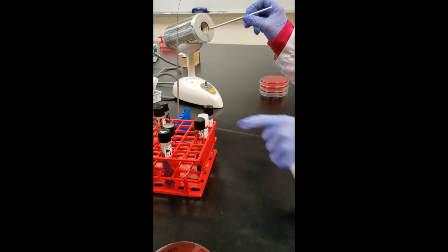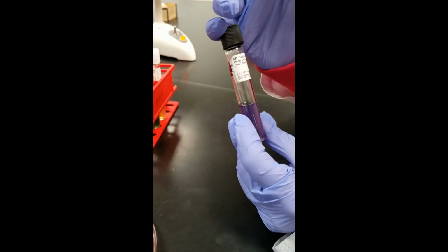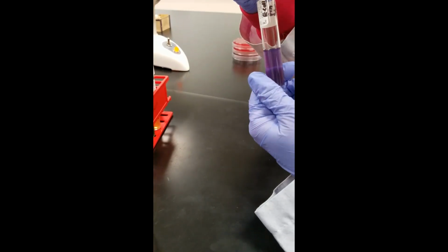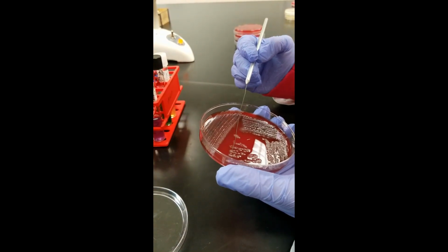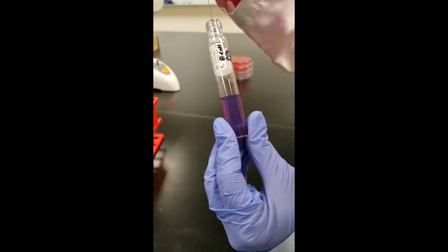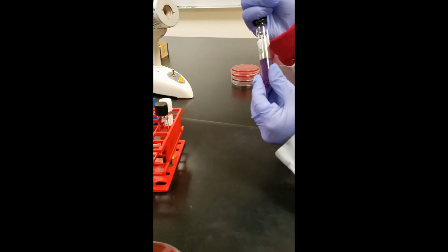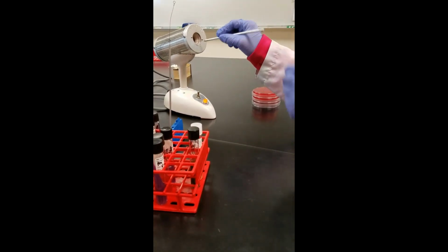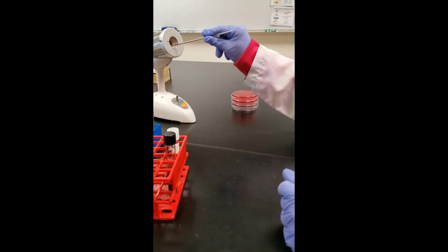The next tube we're going to set up is our MIO. It tests 3 different things. It tests for motility, it tests for ornithine production, and it tests for indole production. Get that tube ready. Again, I'm going to pick up another colony of bacteria. So luckily I've got a lot of bacteria on my plate. And this just gets one stab about halfway, 2/3 of the way down. One stab, and then that's it. Loose caps, do a quarter turn back. Then we're going to get rid of our needle and switch to the loop for the other 2 tubes.